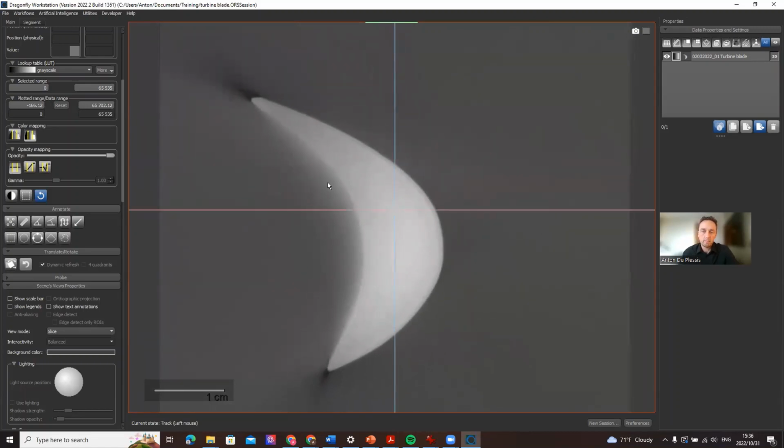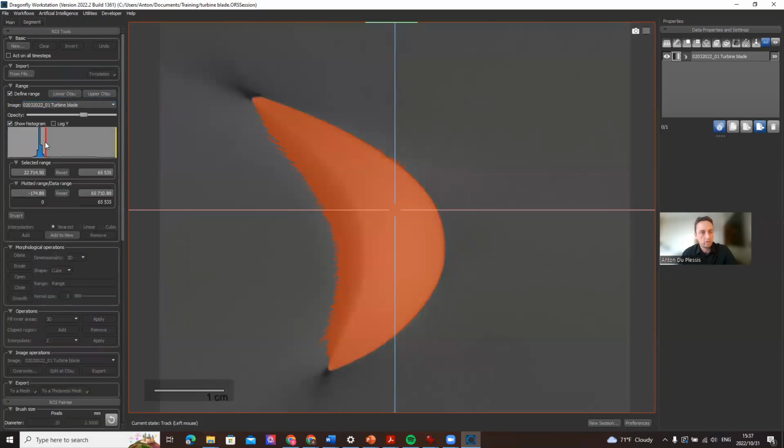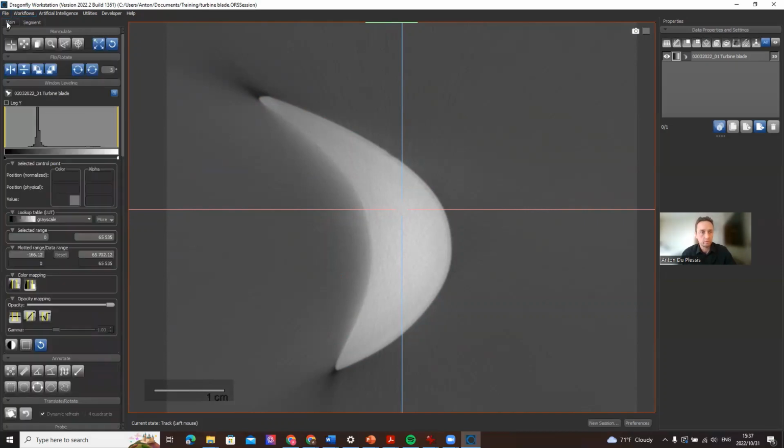This is a typical example of CT data where it's difficult to segment this blade. Just to show you the segmentation using define range or showing a histogram selection, you would have difficulty thresholding this due to the grayscales. That's why it's useful to apply image filters to improve this. This image filter is a very useful tool to compensate grayscale changes.